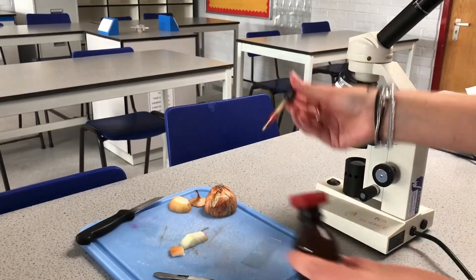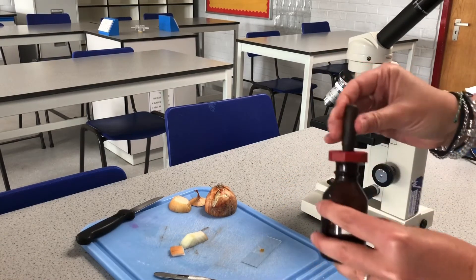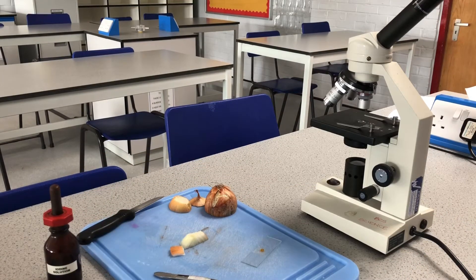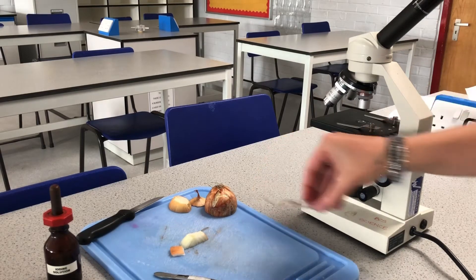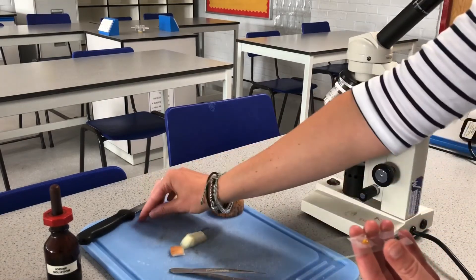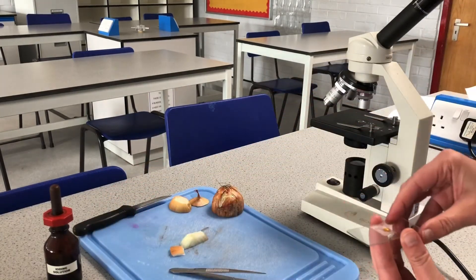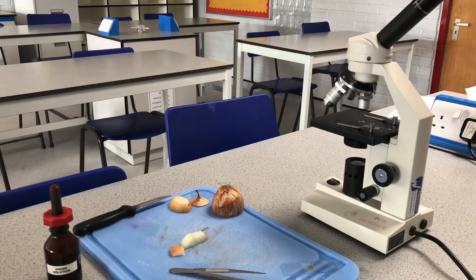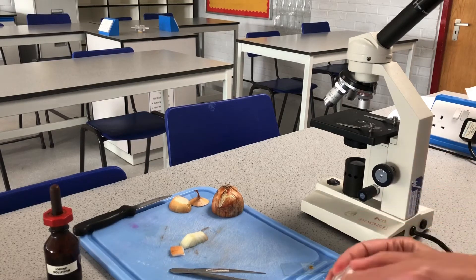I'm going to use some iodine solution to stain the sample — just one little drop. That's going to allow the key subcellular structures to be seen more easily, so the nucleus and the cell wall will be highlighted using that iodine solution. Now I need a cover slip — I'll have to get another one out.